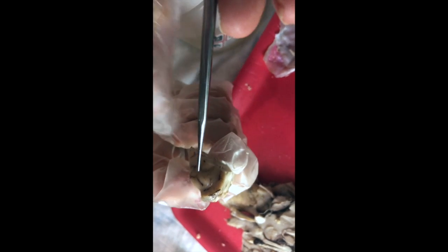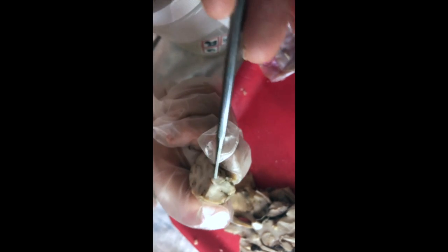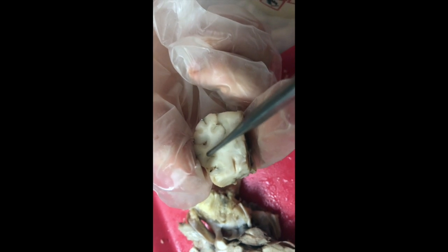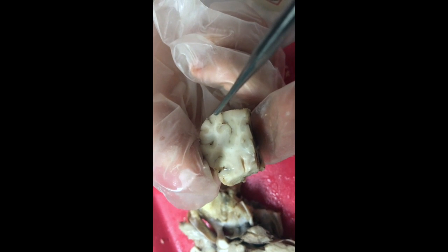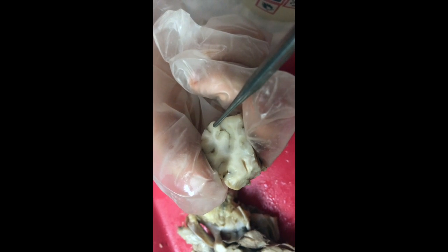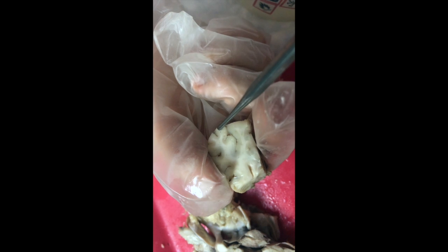Alright. So what Tobias has in his hand is a piece of the cerebral hemisphere. Turn it on the side for me so you can see where it's been cut. If you look inside that piece, you will see the white matter on the inside and the gray matter on the outside of all the gyri. So this gray matter on the outside of the gyri is the cerebral cortex. And that is where all of your integration function is going to occur.